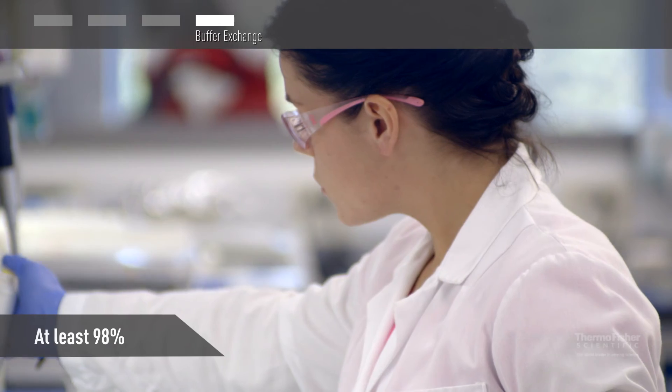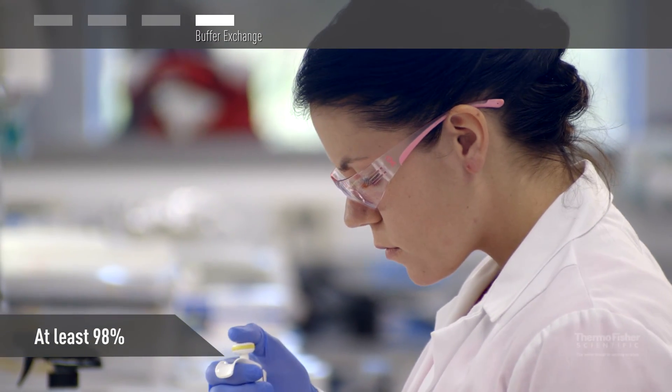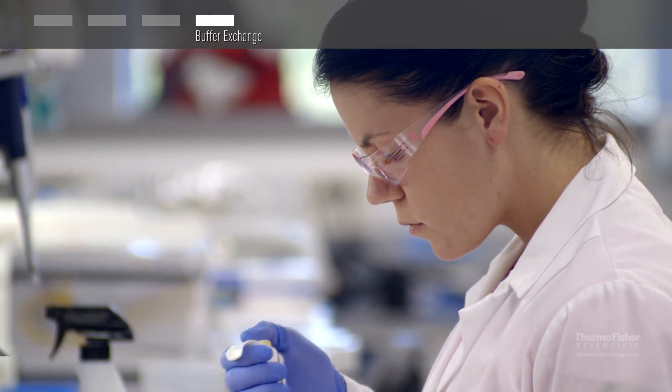Typically, salt content can be reduced by at least 98% with just one exchange with water or salt-free buffer.